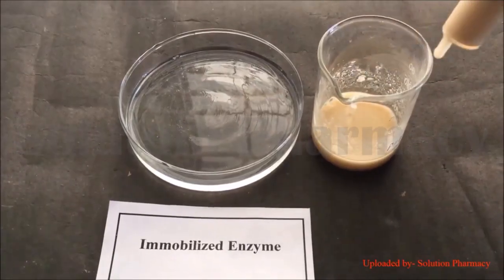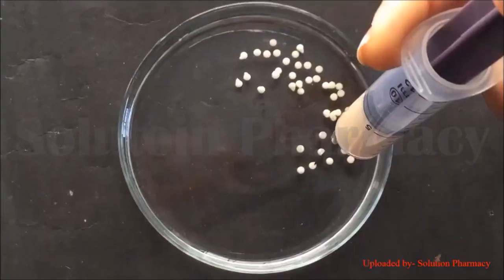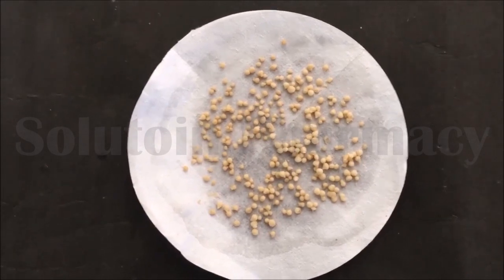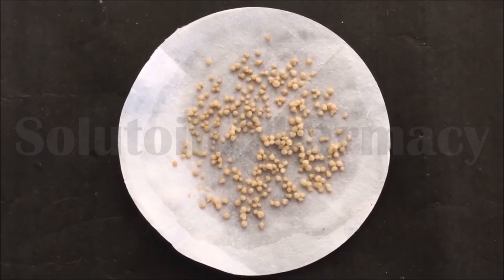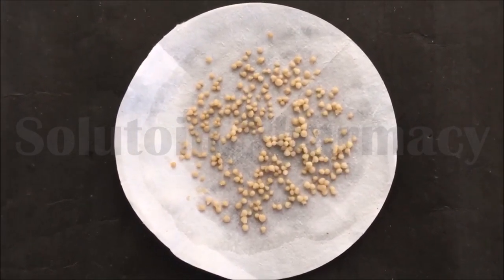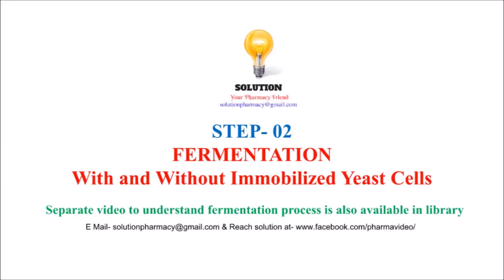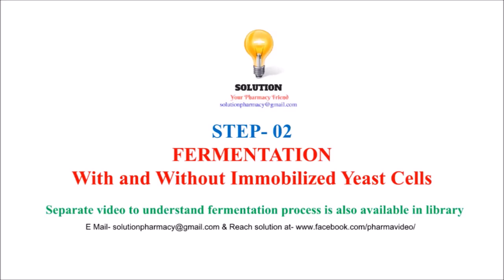In this video we have fast-forwarded the first part of this experiment. After immobilization of the yeast cell in sodium alginate, we dry the sodium alginate beads, and after drying we will use this immobilized yeast cell for the experiment. In the second part, we repeat the fermentation process with and without immobilized yeast cell to compare the two.